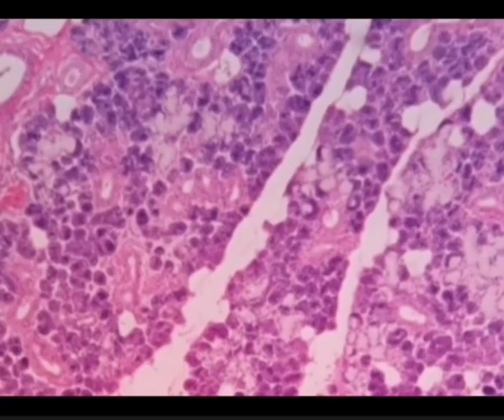A bit blurred, but you can get an idea that these darker ones are the serous acini, the lighter ones are the mucous acini, and now you can see here, this one is a serous demilune, this one is a serous demilune, right? This one is a serous demilune, this is a duct, this is a duct, right? And if you see a duct-like thing but it has a central reddish thing, it means red blood cells are there. So these will be vessels, so don't confuse the ducts with the vessels, right?